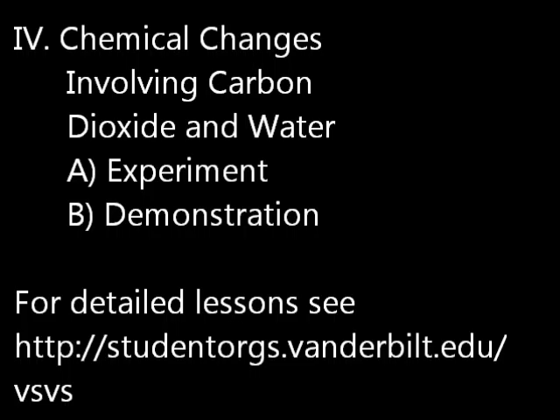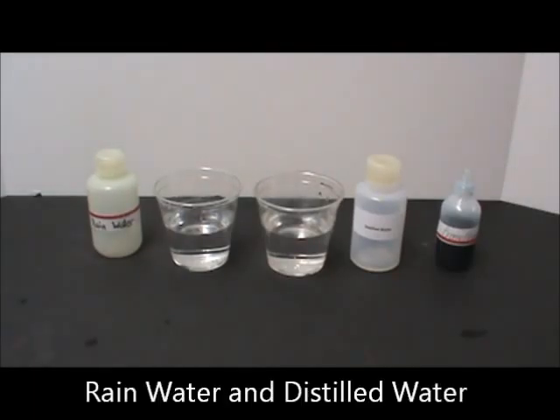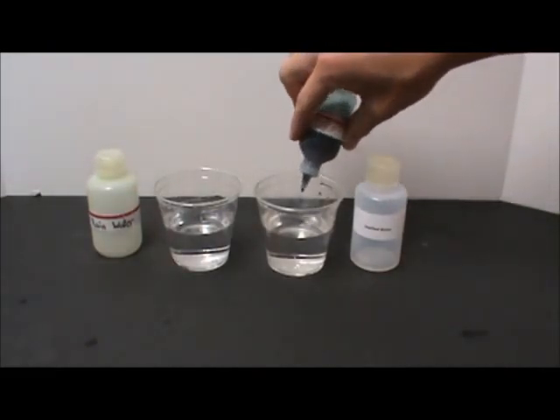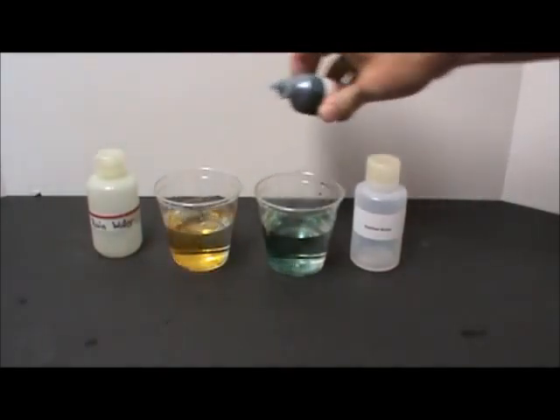Demonstration. The materials needed for this demonstration are 2 plastic cups, 1 filled with rainwater and 1 with distilled water, and bromothymol blue. Add a squirt of bromothymol blue to each cup. Discuss observations with students.